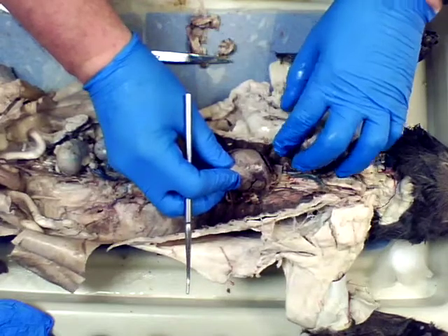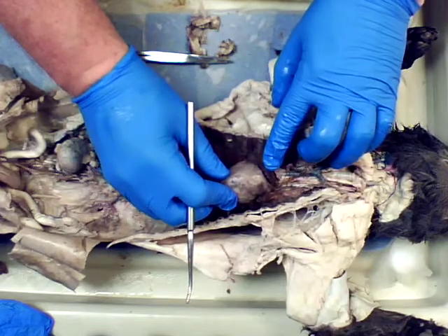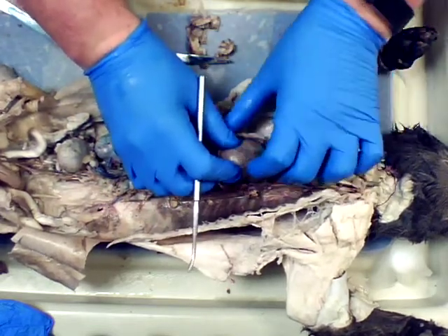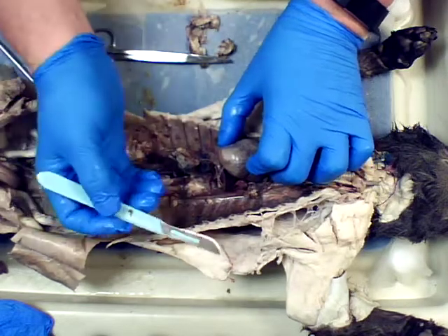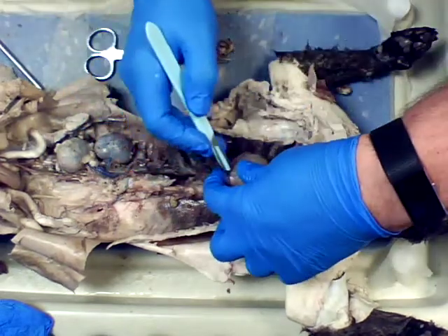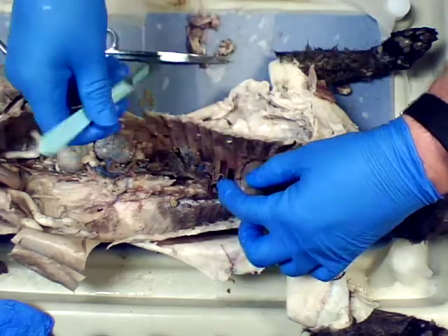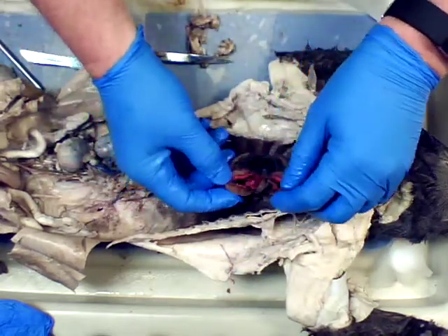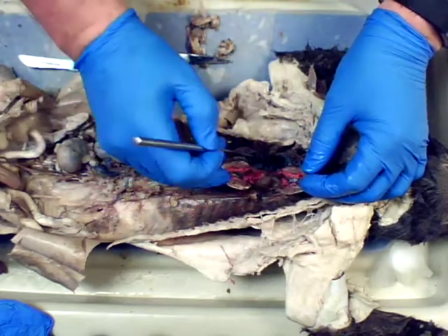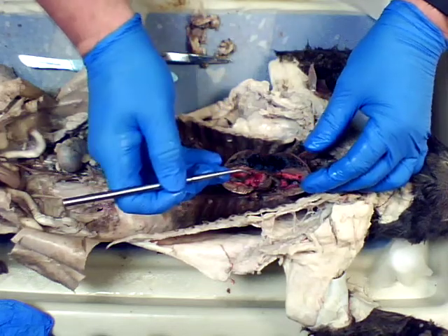So I've taken the pericardial sac off of here, which was a covering around it, to expose the right atria, left atria, so the ventricles will match. And what we've been able to do is take the scalpel and cut the heart just like we did with the sheep heart, and be able to open that up, and open up this heart to expose the internal portions of the heart and show the blue, which is on the cat's right-hand side. So this is the right atria of the heart.